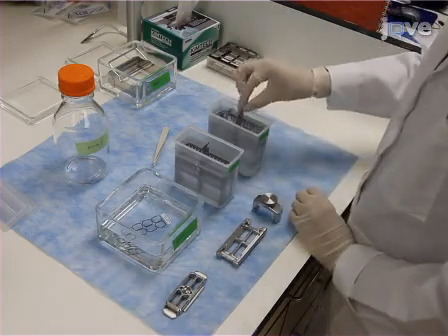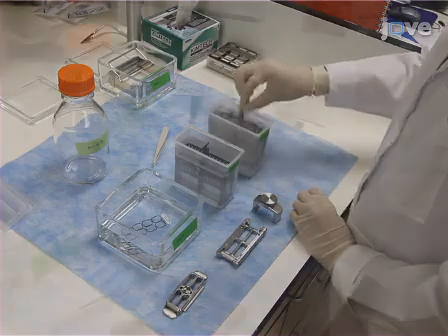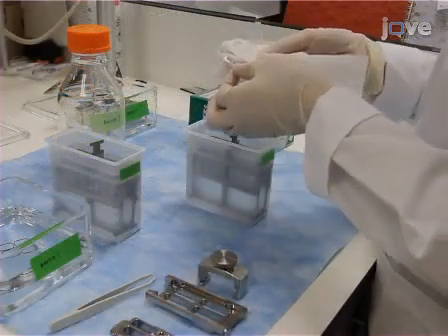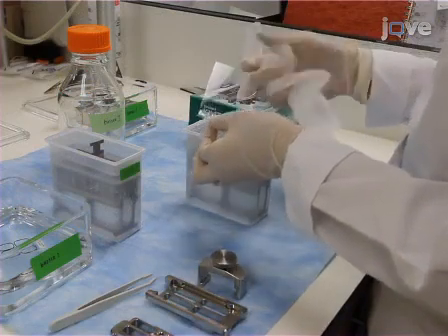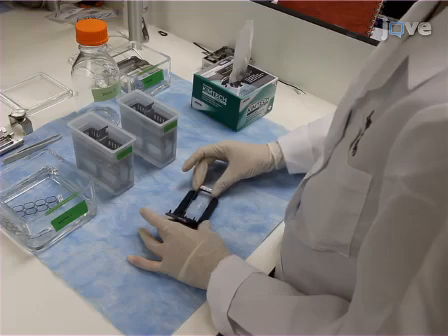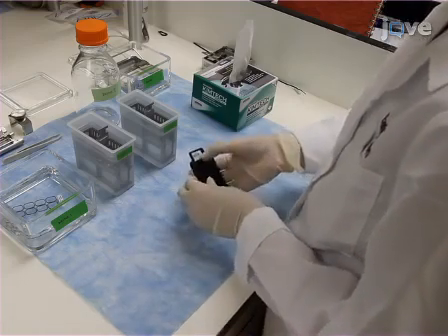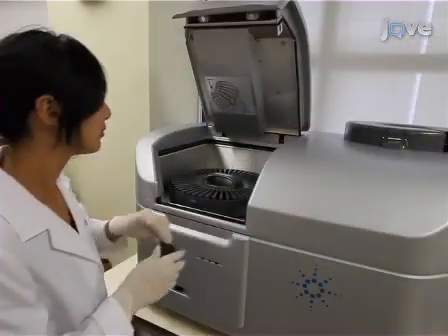After washing, slowly remove the array from buffer 2, being careful to avoid bubbles. Use a Kim wipe to wick away extra moisture, while being careful to avoid directly touching the active side of the array. Finally, place the slide into the slide holder, Agilent side up, and insert into the array scanner.